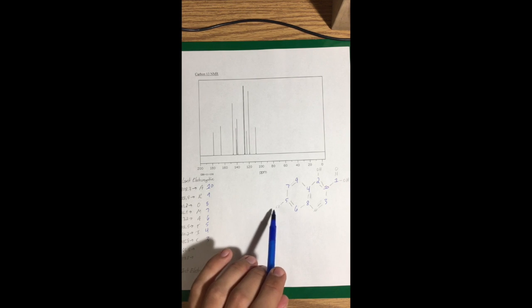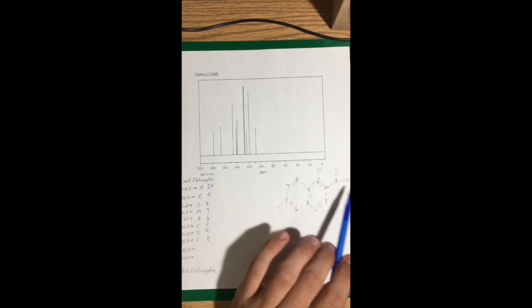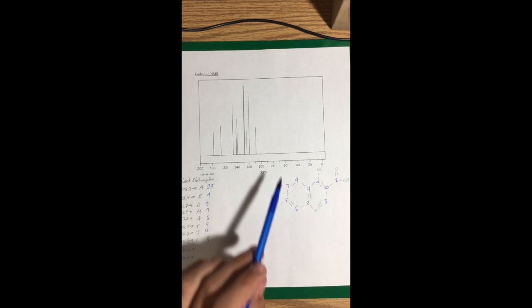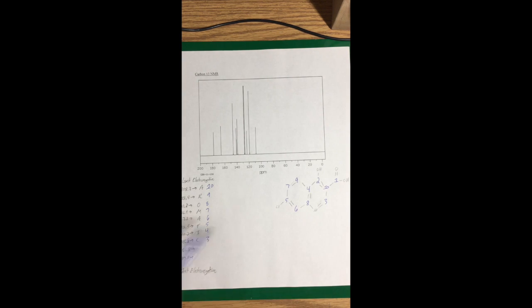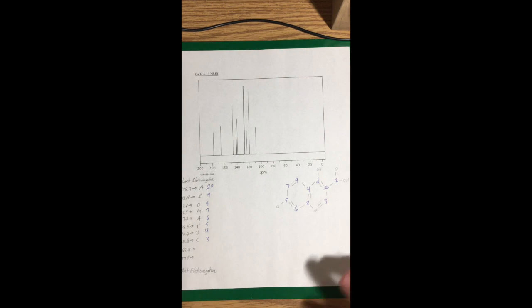6 is somewhat close to this chlorine, which can be electronegative, but not as bad as this alcohol and carboxylic acid. So that's why the 5's on the chlorine. And then 4, working our way up there. It's right here. 3, getting pretty close. And then that wraps up for the aromatics.